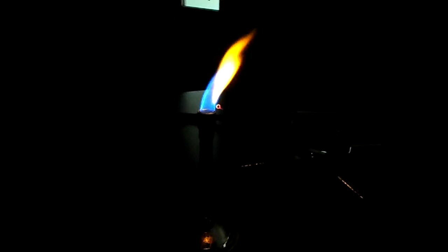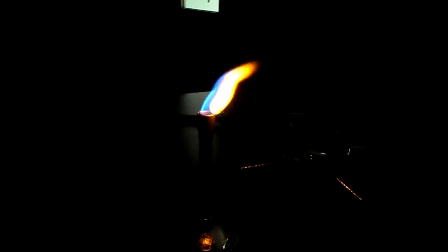Okay, we can see calcium again is showing an orange color, similar to sodium. Okay, I'm going to clean it off. Make sure there's no more calcium on there.